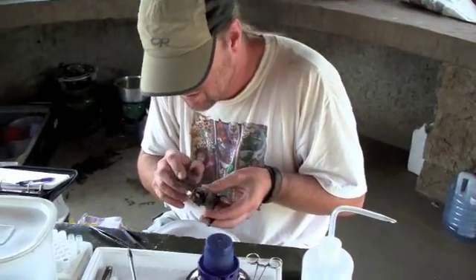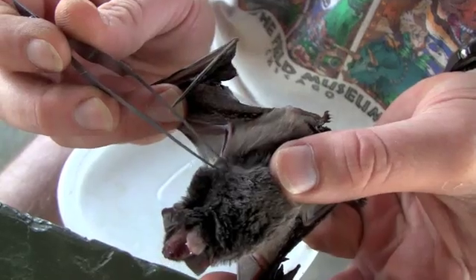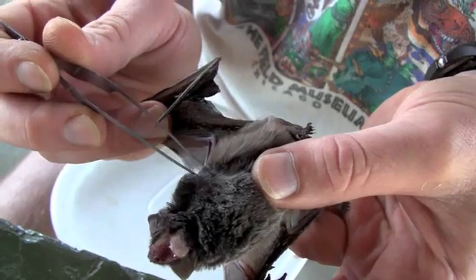There's another. Because when you pull them, it seems to be the tarsal claws hanging onto the hairs.